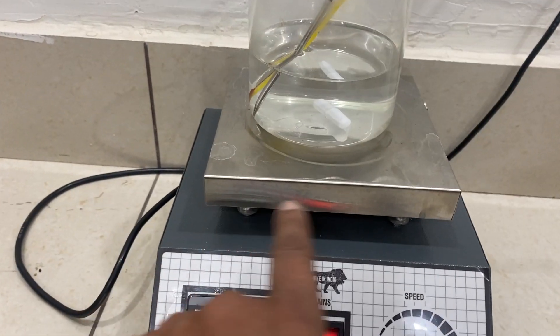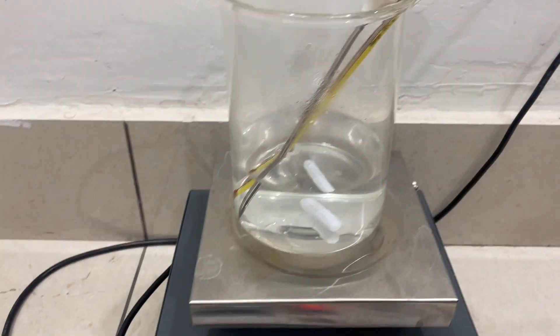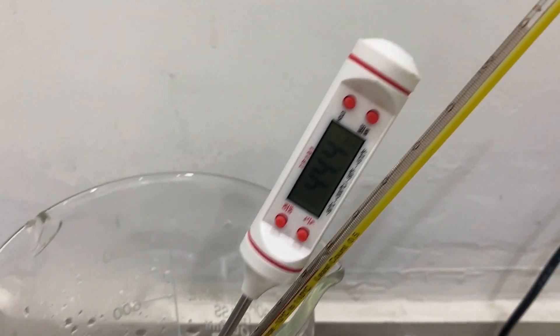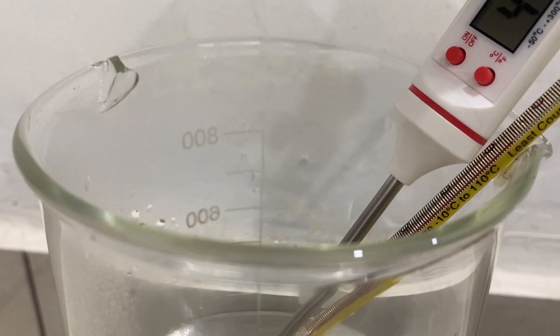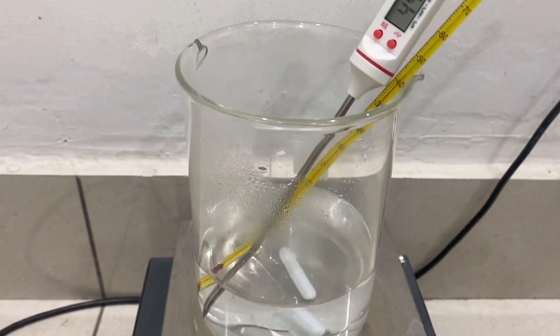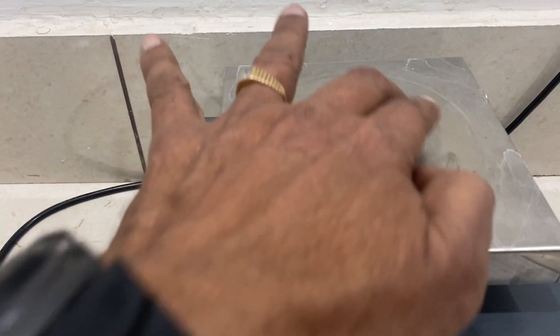The controller surface is very hot. I have set it to 85, but since the temperature area is open, the temperature attained is almost 44 to 45 degrees centigrade. You can see this is alcohol also. Since this is an open area, the center part always has a lesser temperature because this is the stirring part.